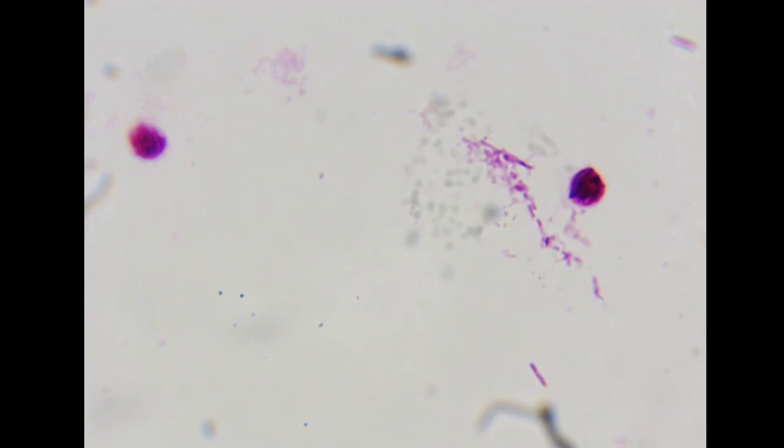Some of the classes we have trained for are bacteria, algae, virus, and paramecium, or better known as parasites. You'll see some of the other classes later in the demonstration. So right now, you're seeing the colored material. That is the 100x oil immersion lens looking at the stagnant water slides. Let's run the AI and I'll walk you through how it works.